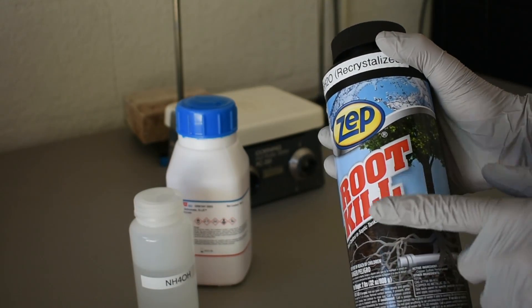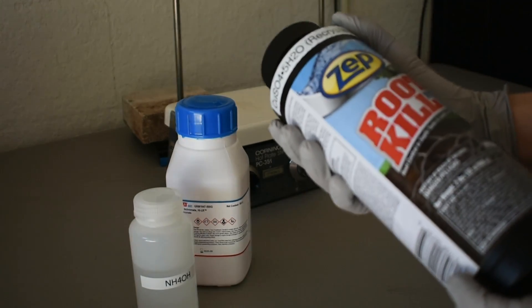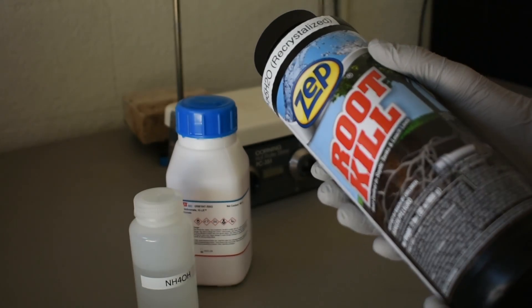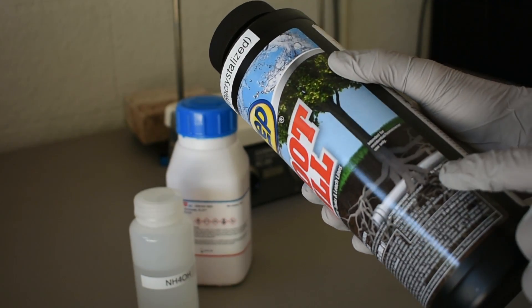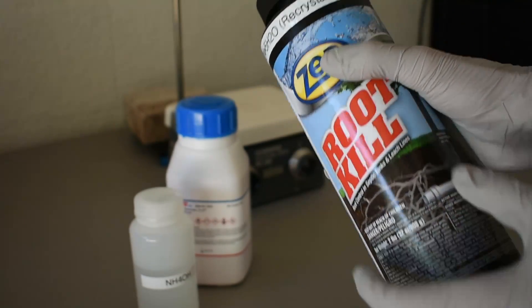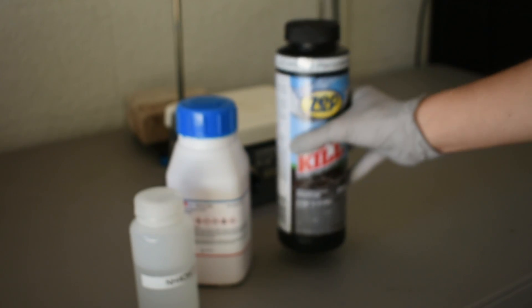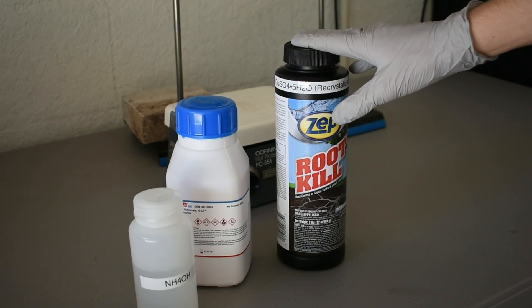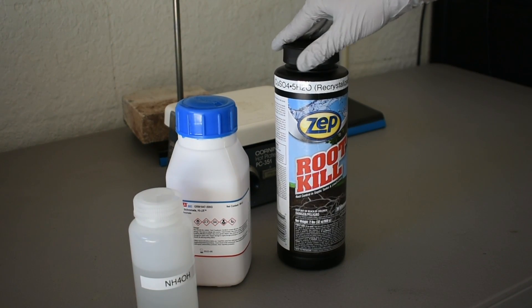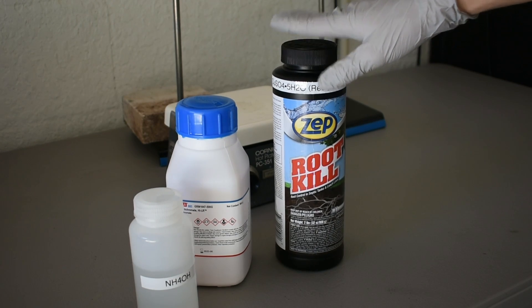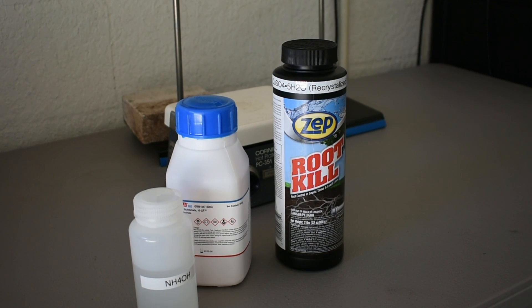Now you can buy it as this root killer for drains, and it comes reasonably pure. It says 99% on the bottle, but I just went ahead and recrystallized mine, just to make sure that it's completely as pure as possible. So I'm going to set up everything here, and we'll go on with the synthesis.